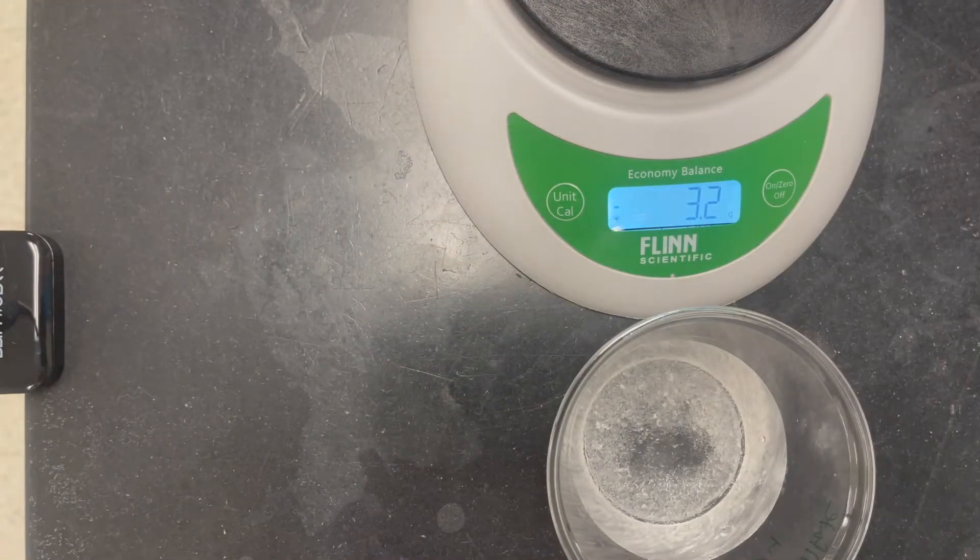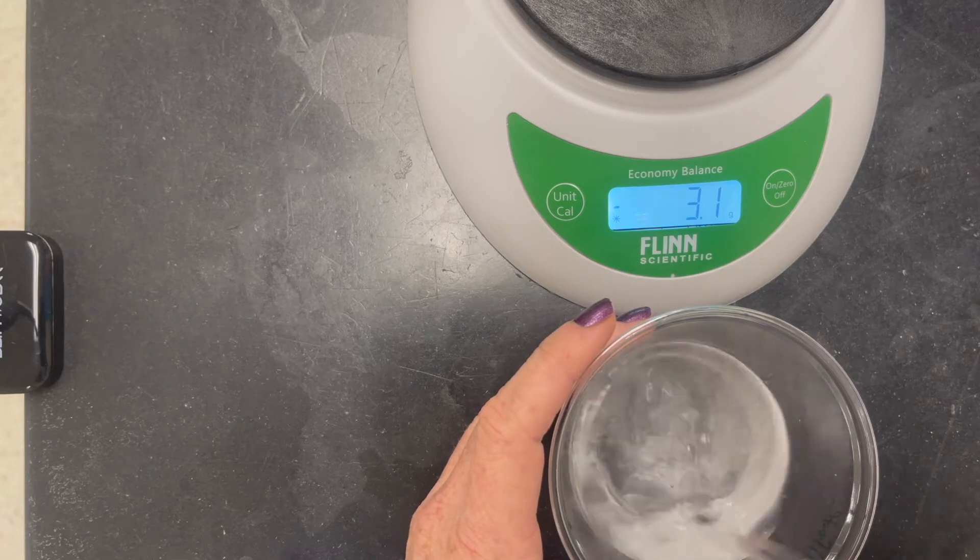Pour the Magnesium Sulfate into the water and stir until it is dissolved.